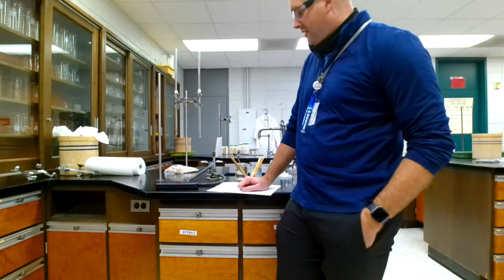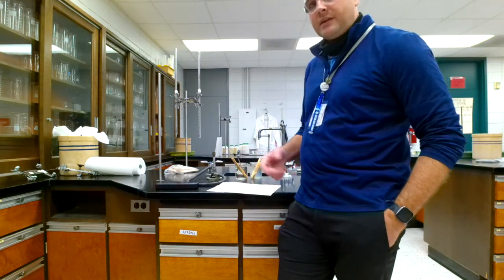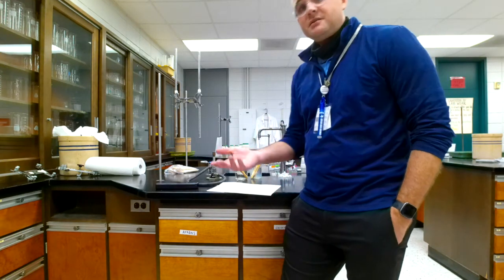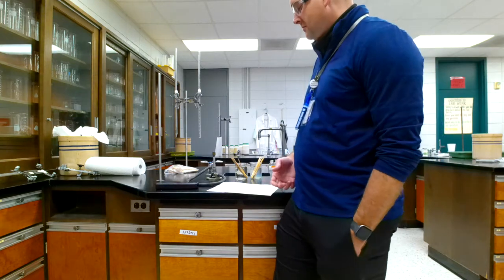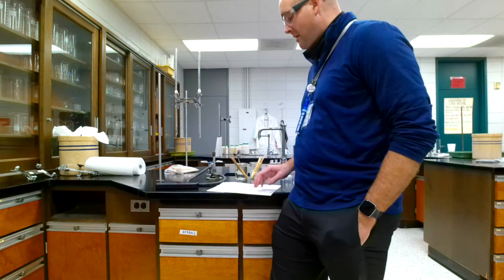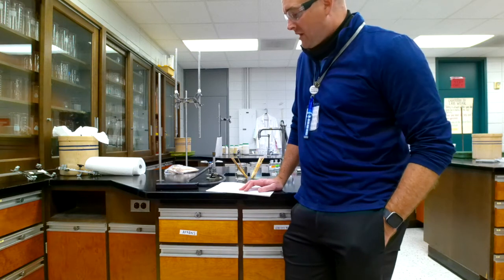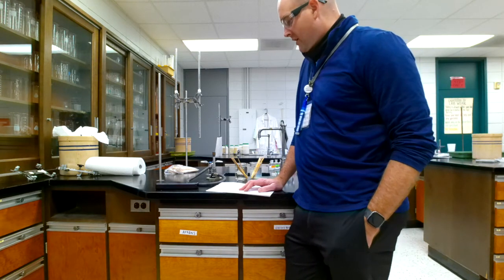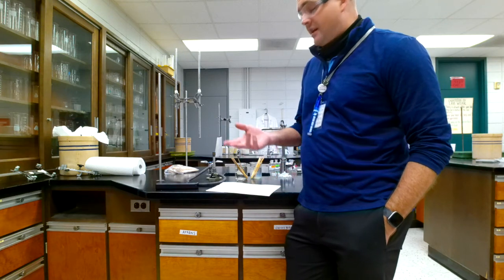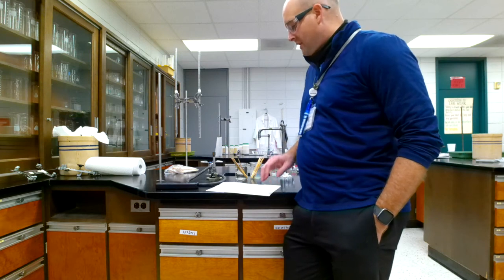Two difficulties that may occur during using a flame test. Well, you saw some compounds had similar colors, so that might be one difficulty. I bet you could think of another one. Why does sodium chloride and sodium nitrate have the same color or impart the same color? Well, we kind of went over that.